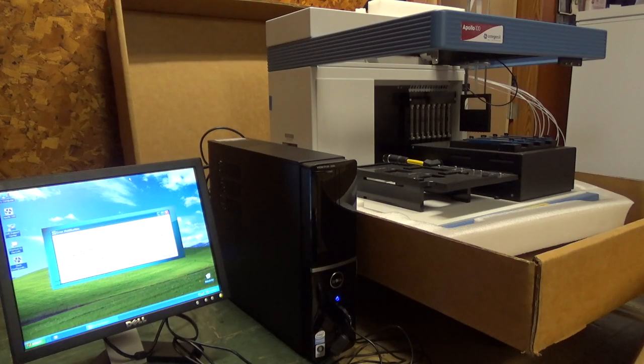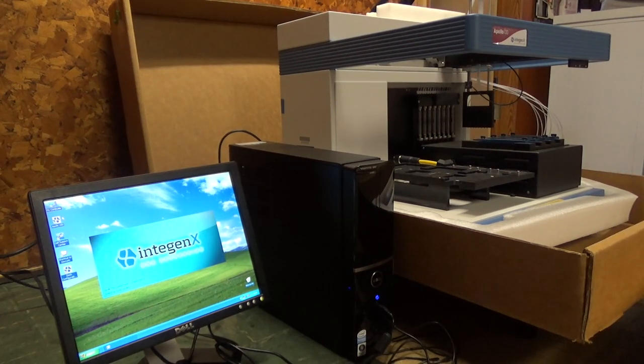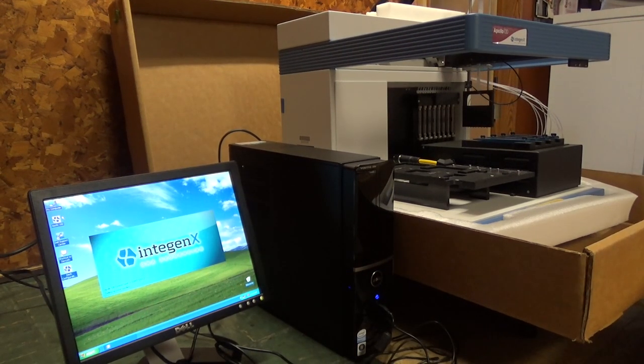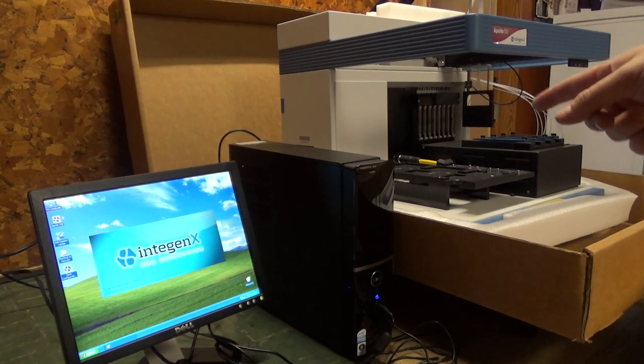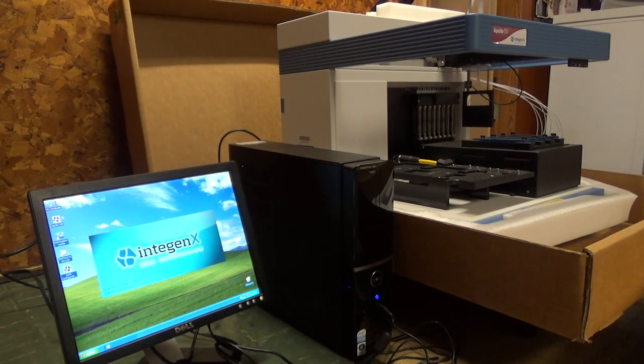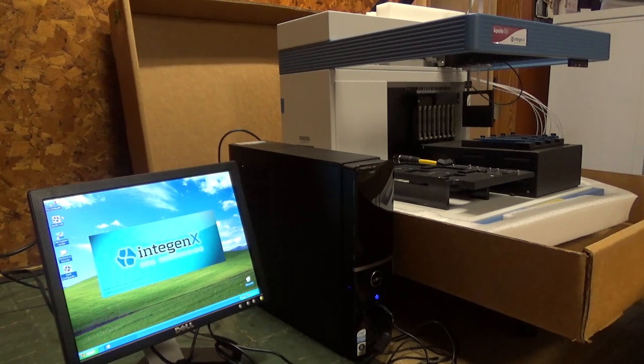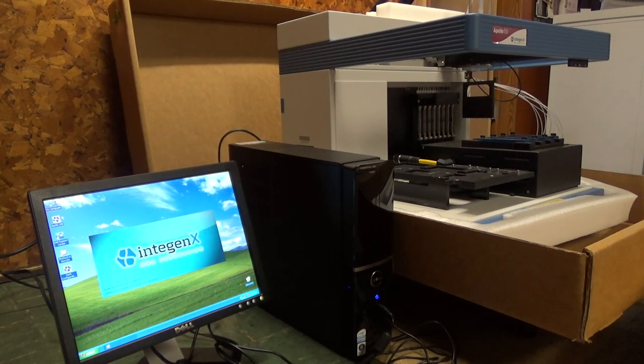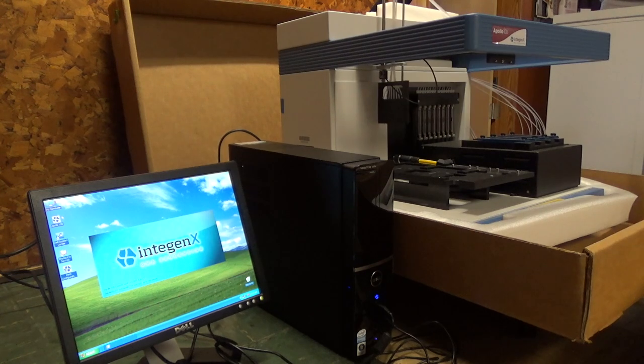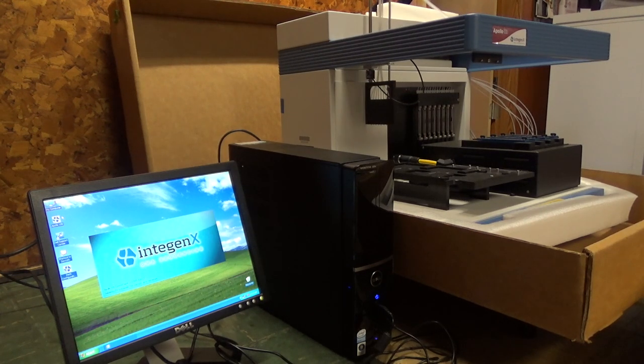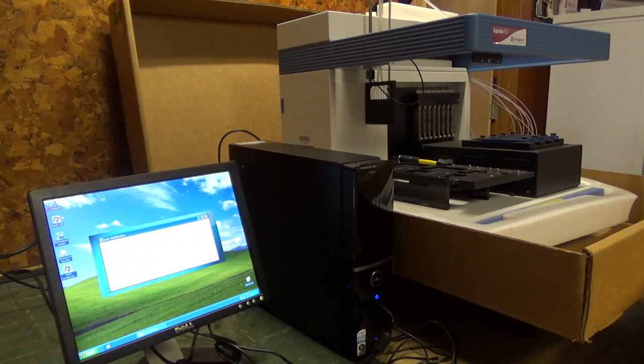Okay, we're still getting initialization errors. We're gonna try this again. We've skipped the USB to serial adapter. We're just going straight from 9-pin serial on the Dell to 25-pin serial on the device, and we're loading up the software again. And we've actually got some motion on our robot arm now. Oh, that sounded terrible!